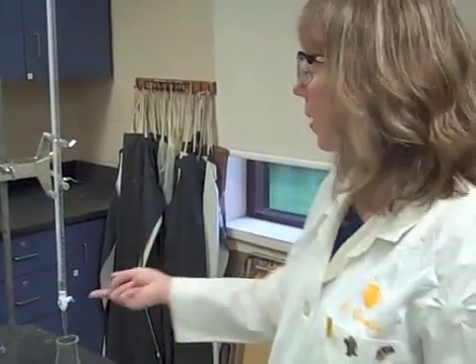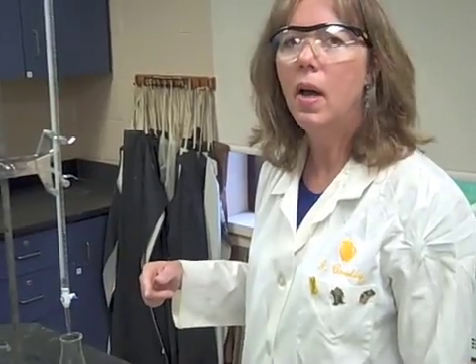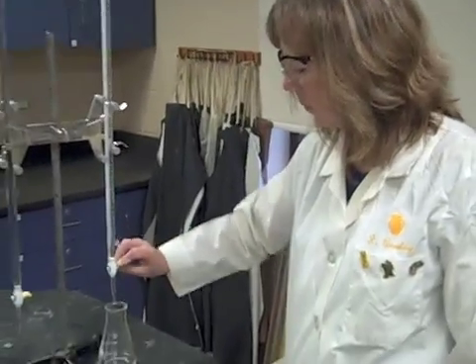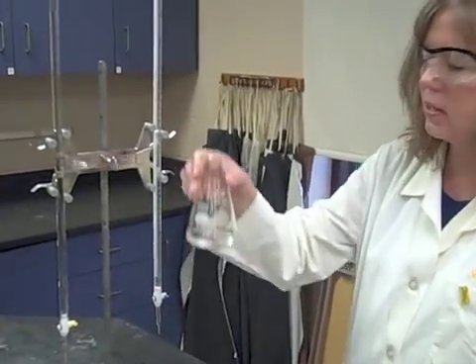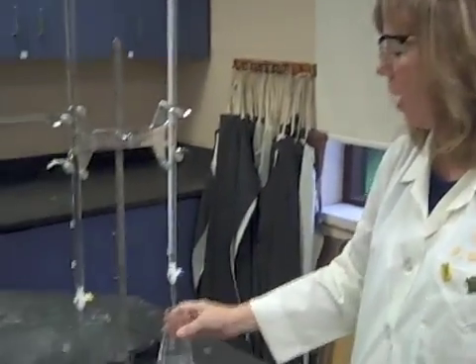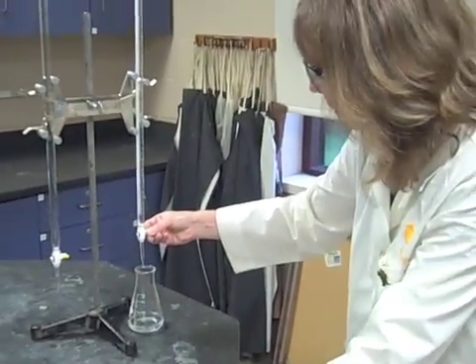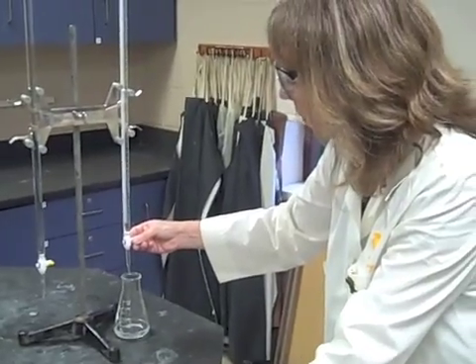For the very first one I'm going to do is I'm going to do 180 degrees. And the reason why I'm going to do that is I want to make sure that I'm not already at that endpoint because I'm just using such a small amount of the acid. So, here we go. And notice that you see already a little faint pink from where it dropped.